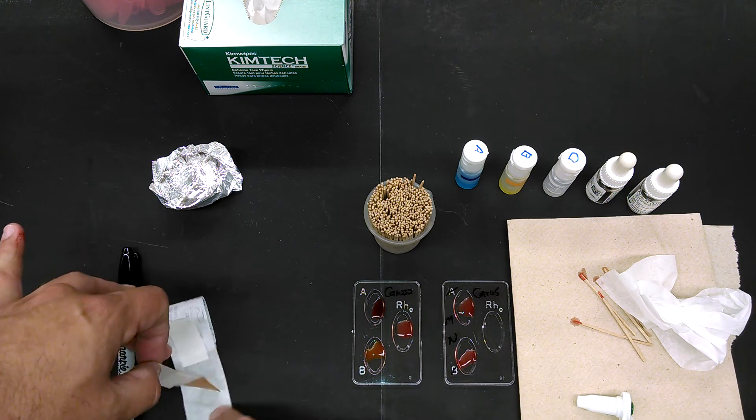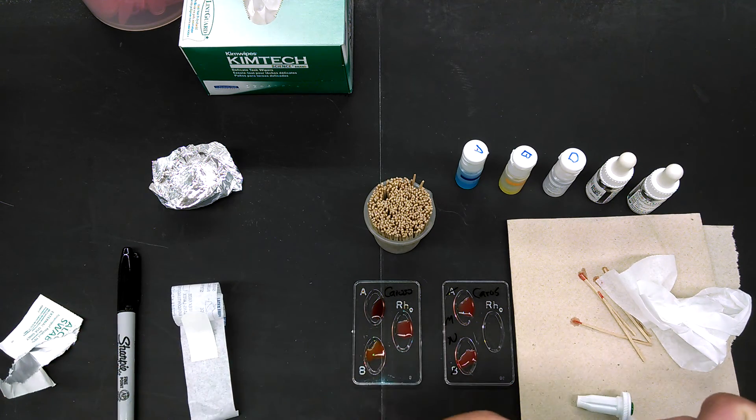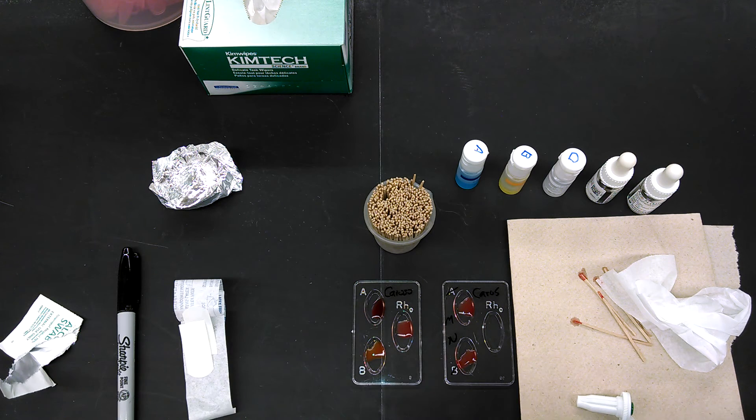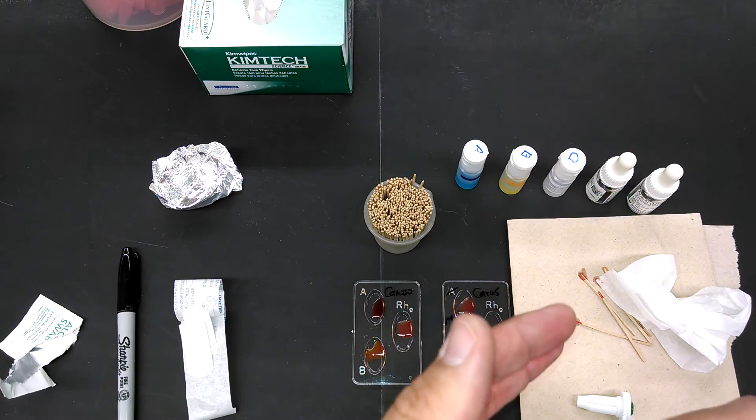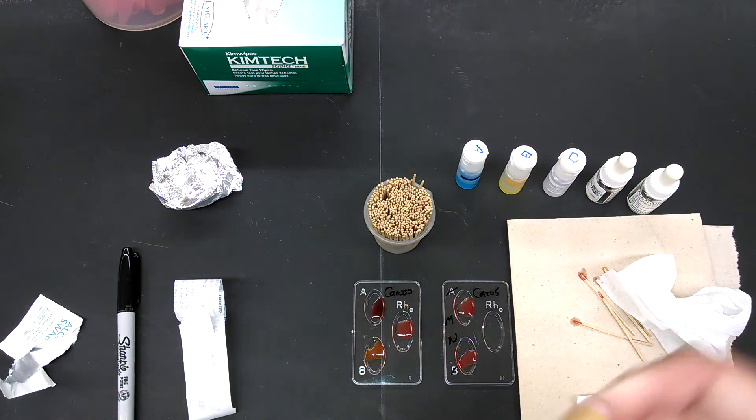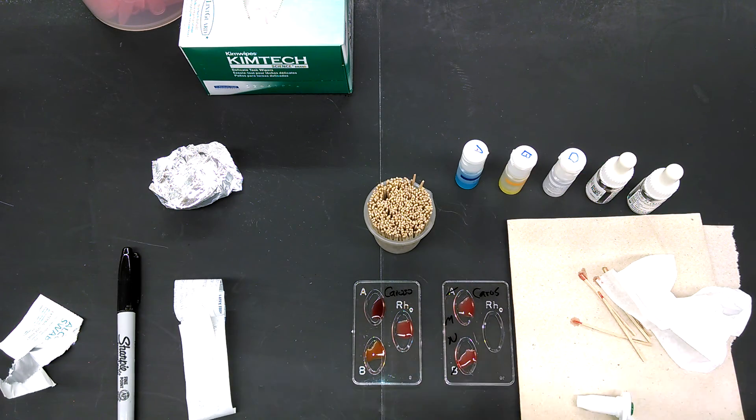Anything that touches human blood, no matter what you know about how safe you are, is considered biohazard. So make sure it goes in the biohazard waste in the lab. That's it. I'm fine.